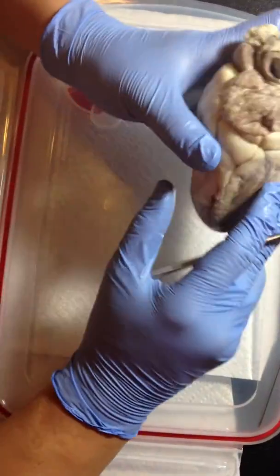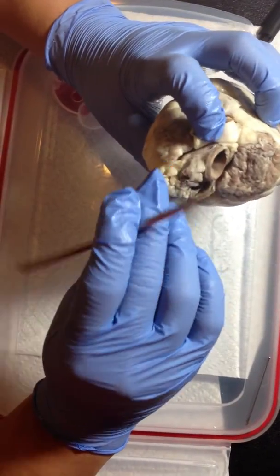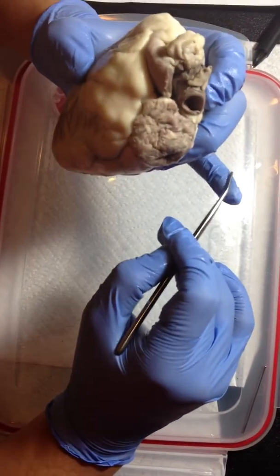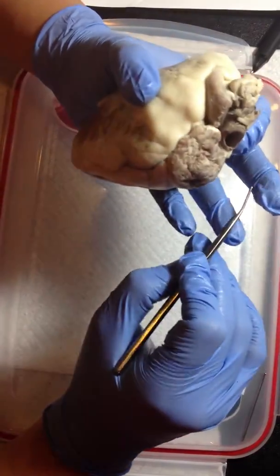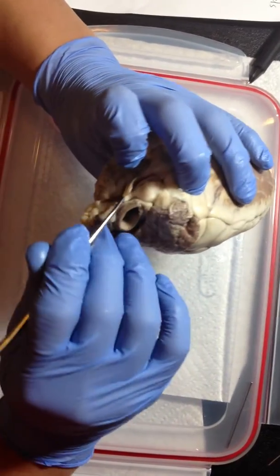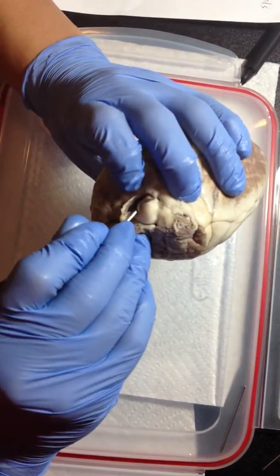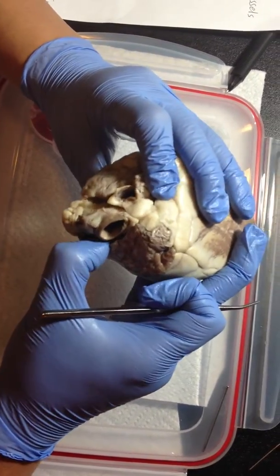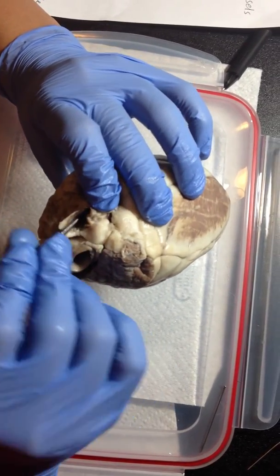And then the aortic arch and its three major vessels. We were supposed to locate three of the major vessels of the aortic arch, namely the brachiocephalic artery, the left common carotid, and the left subclavian. But unfortunately, as far as I can tell, I can only locate the brachiocephalic artery, which, if I'm not mistaken, is this one here.